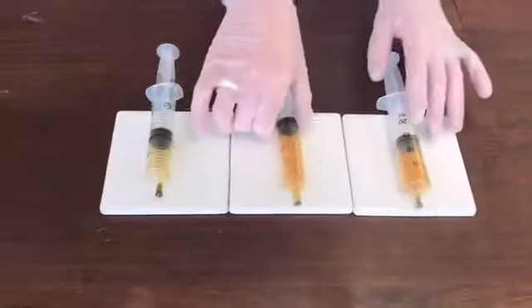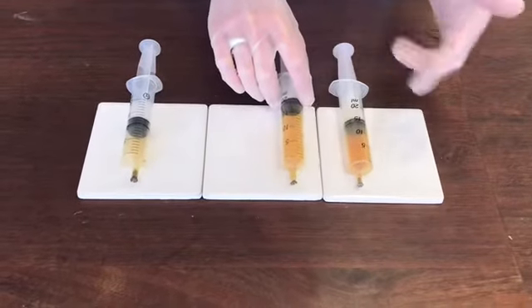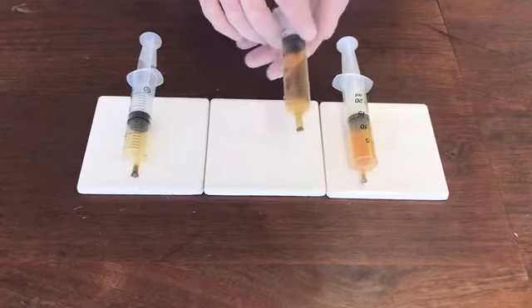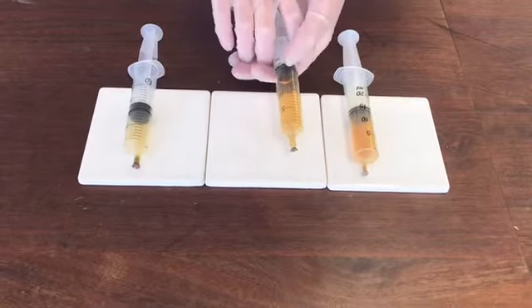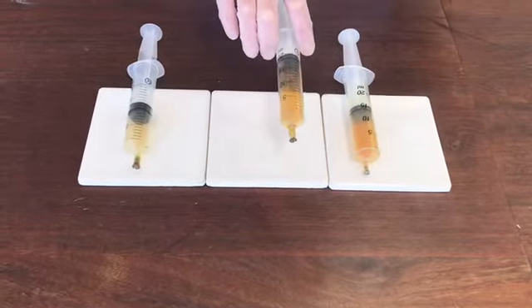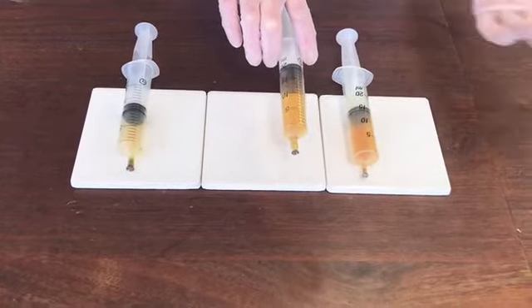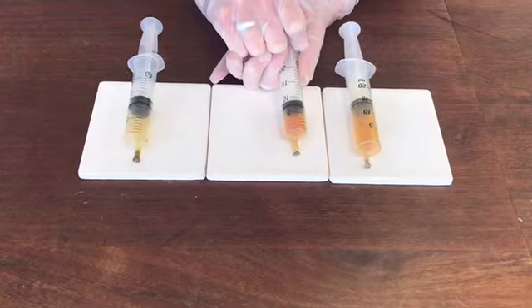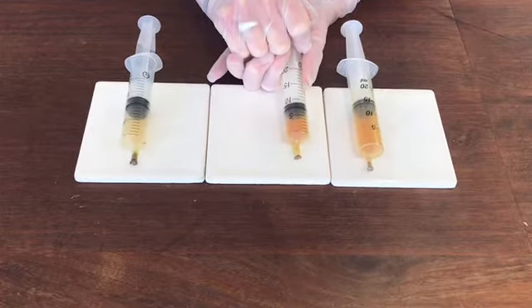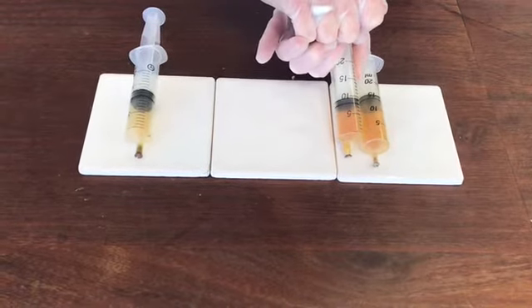So I've got 2 syringes here side by side, so you can see that they're starting at the same colour, and that will help, I hope, to give us a kind of comparison. So what I'm going to do is push the plunger in on this one, and we hope that we see it go darker initially as I squash all that NO2 into a smaller volume, and then we should see it start to lighten again as it's clearly re-establishing that equilibrium mixture. So here we go. So it went darker initially and now it's got lighter again. So it's practically the same colour as the syringe over there.